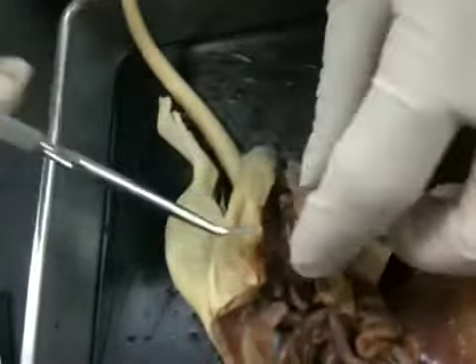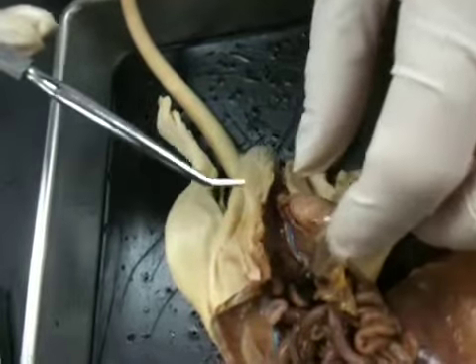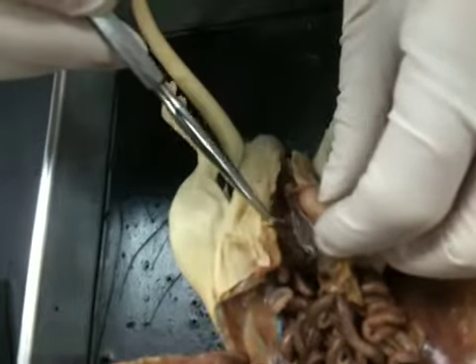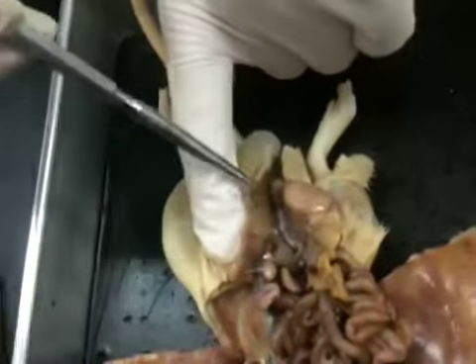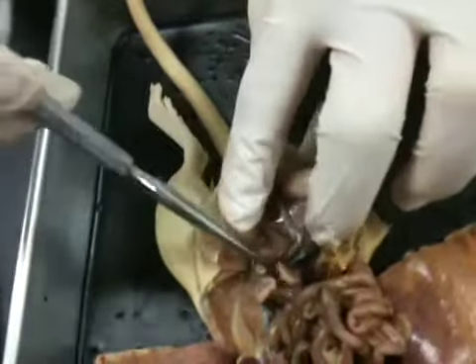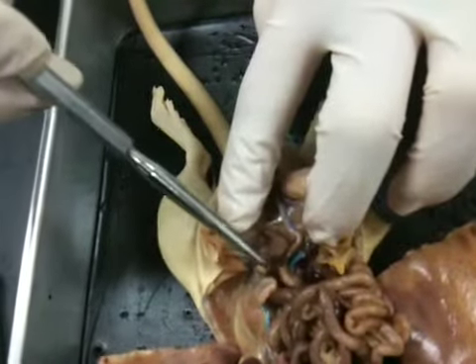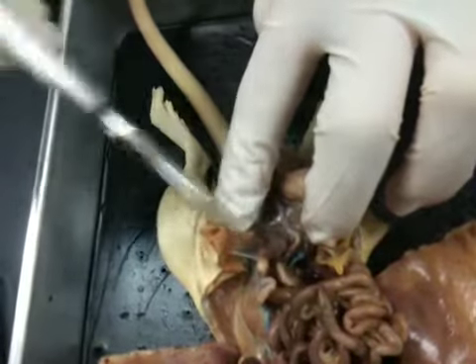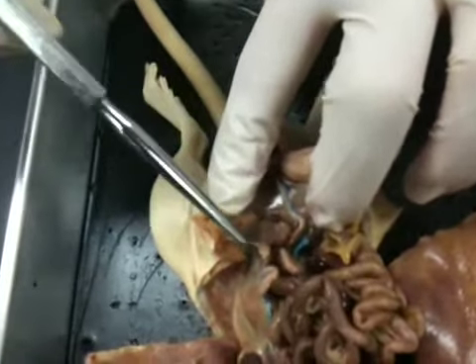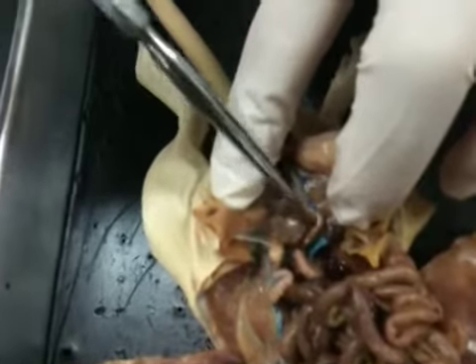The vas deferens then. Vas deferens are running from this all the way up here. All right, so this tube right here is the vas deferens. That's going to carry the semen and come up where it will be added to from the vesicular glands and the prostate, which is sitting just underneath the bladder. So here's the bladder, there's the prostate up underneath there.